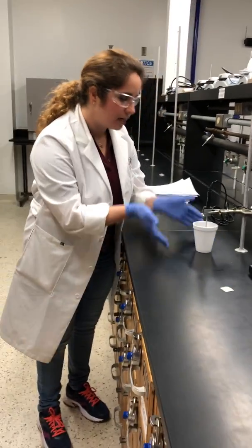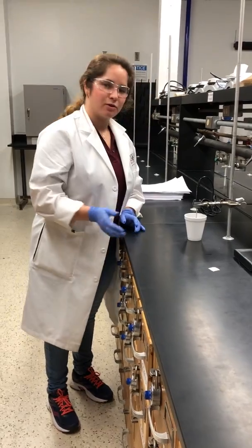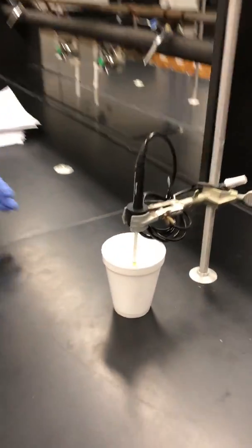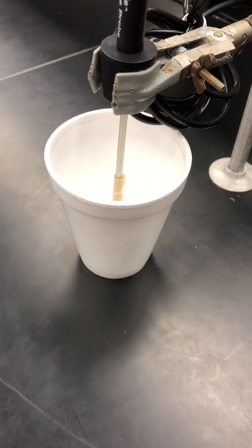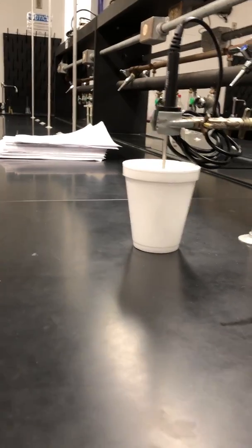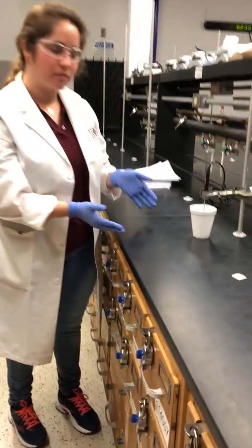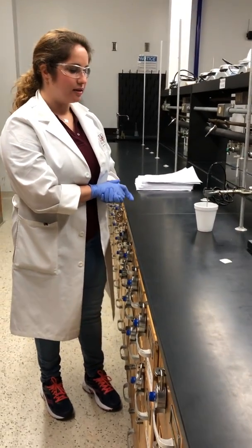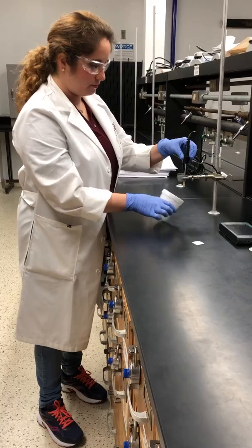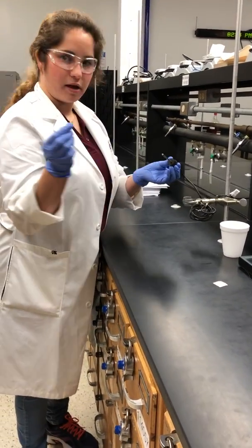Now with the cup in place, it's protecting the filter paper. It only has to be far enough in that the cup is blocking any potential drafts to your filter paper. You'll just let it sit here for the full 180 seconds of data collection, and then once your data collection has ended, you can lift your probe, carefully move your styrofoam cup, and pull off the filter paper.